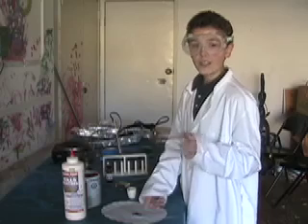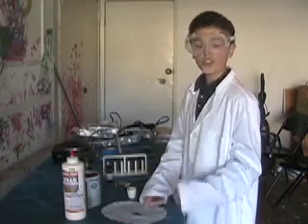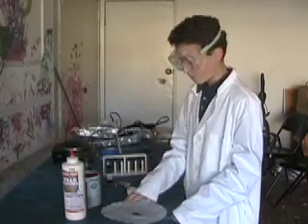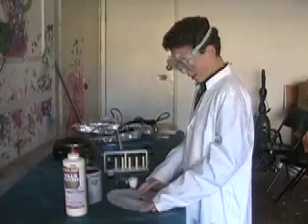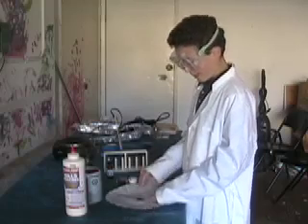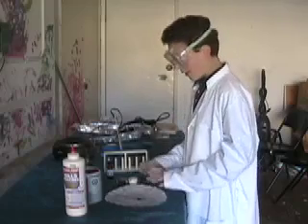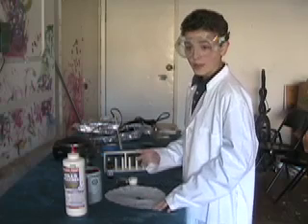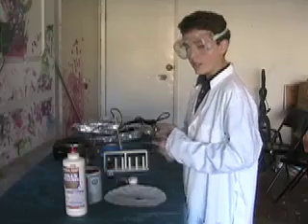I had magnesium oxide and elemental boron. He has a detailed video of how he did this on his channel, and I may be doing a video about that soon. So, I have now shamed boron in saying that it's very boring — it's a boring black powder, kind of like coal. But there's one thing that is very, very cool about boron: if you put it in a flame, it burns a bright green color, and so do many of its compounds.